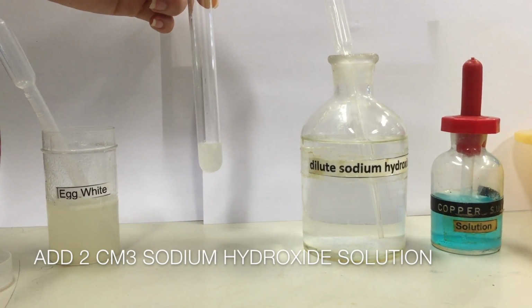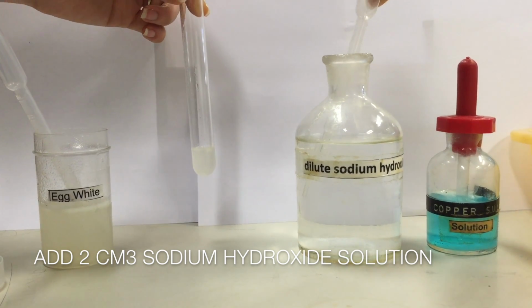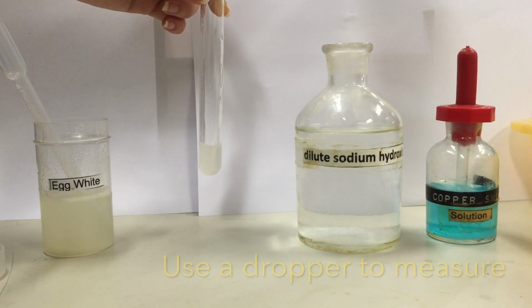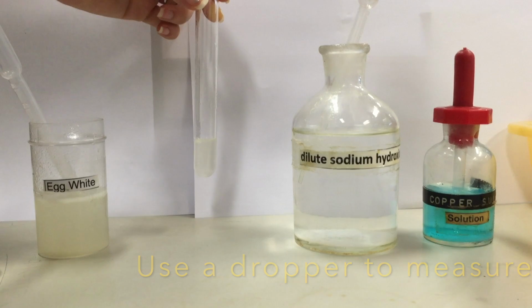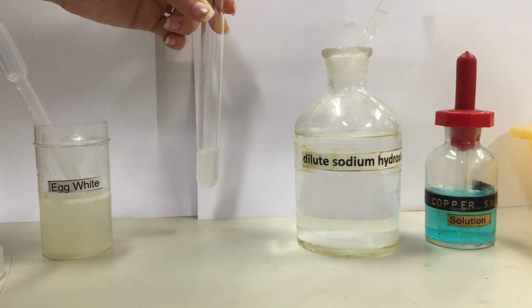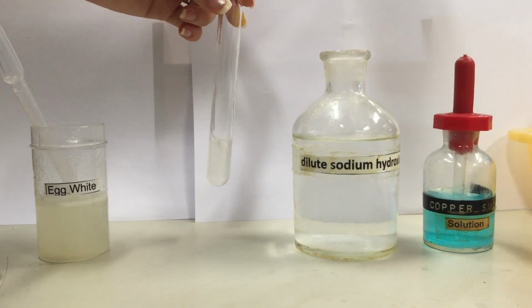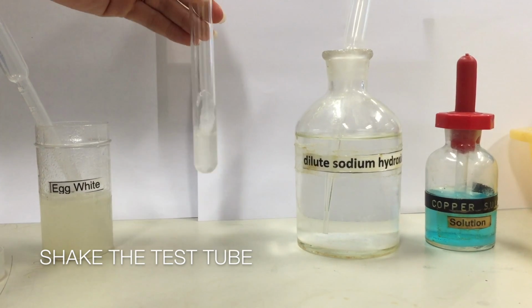Then, we will add 2 cm cube of sodium hydroxide solution to the same test tube. Similarly, we will use a dropper to measure 2 cm cube of sodium hydroxide solution. Next, we shall shake the mixture.